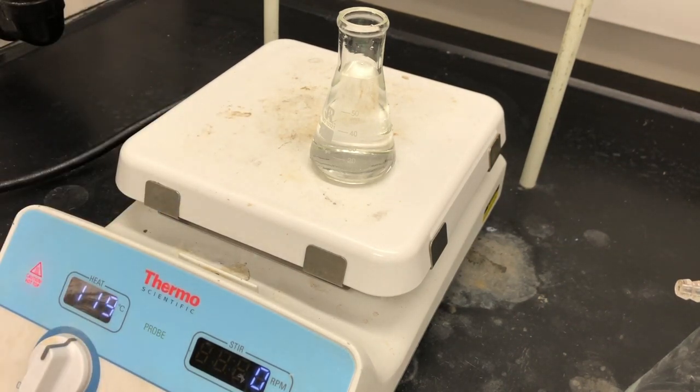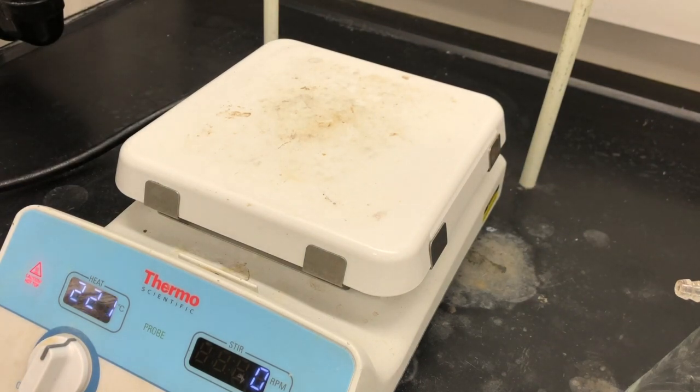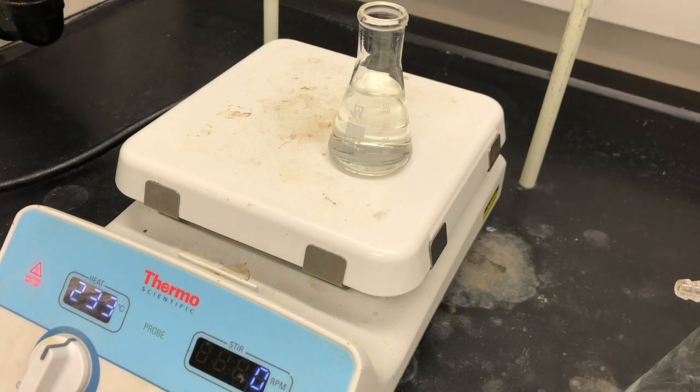You want approximately 15 milliliters of water. I did add a little more than that, so I can actually empty some of it out in case it starts to boil. So you want it right around 95 degrees. You don't necessarily need the thermometer on there. You'll notice it's just right around its boiling point.